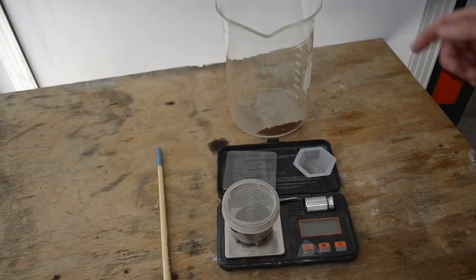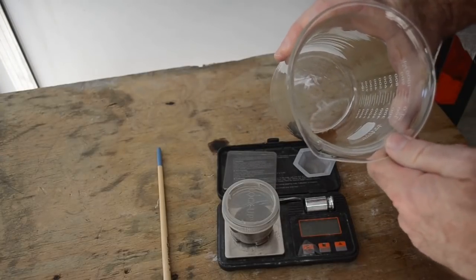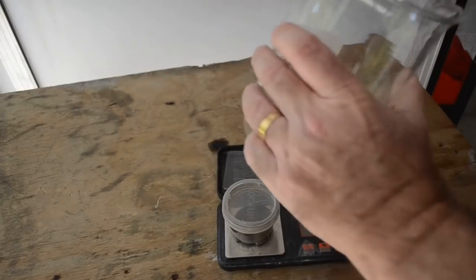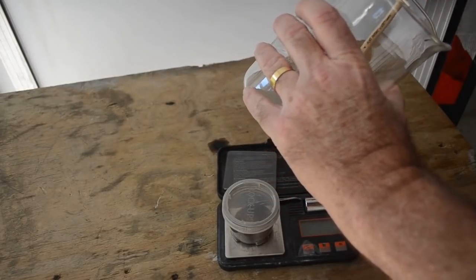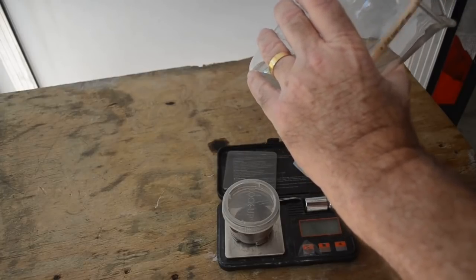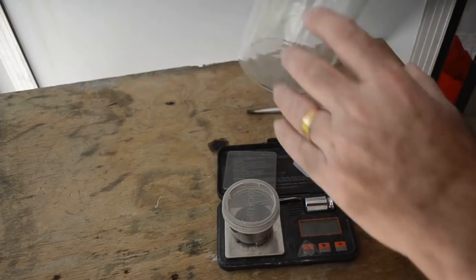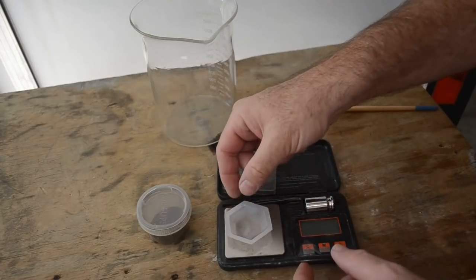Okay, so here we go. The gold has been rinsed in boiling distilled water a couple times. It's all been dried out. It's looking pretty good. It's looking like there's a fair amount of it there too. Let me get it unstuck from the bottom of the beaker here and we'll weigh it up. See just how much there is. It can look like a lot, but you know, until you actually weigh it, you don't know.